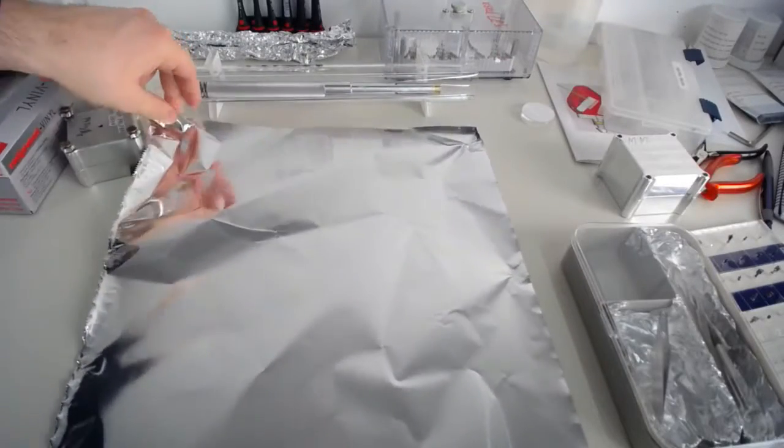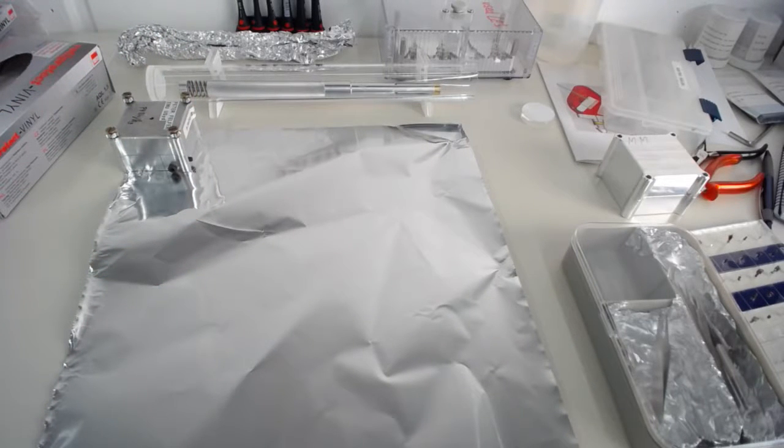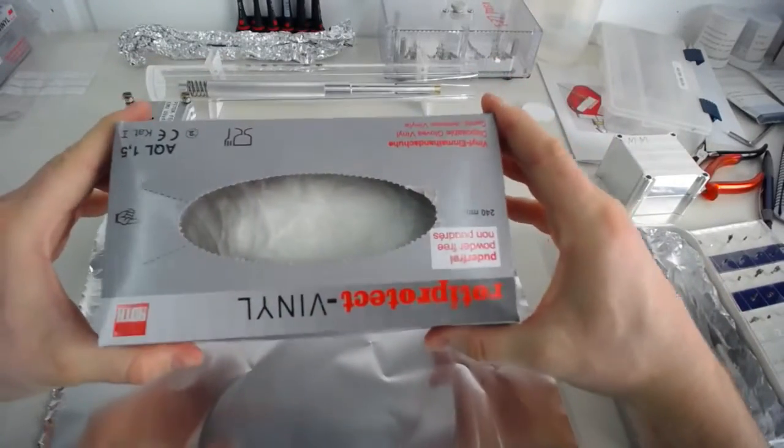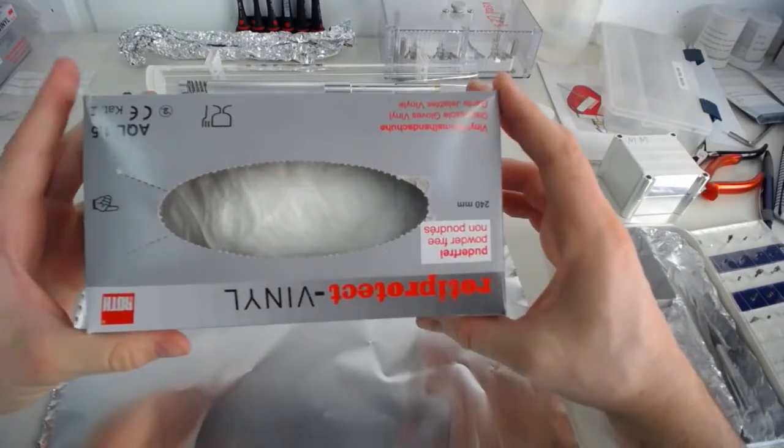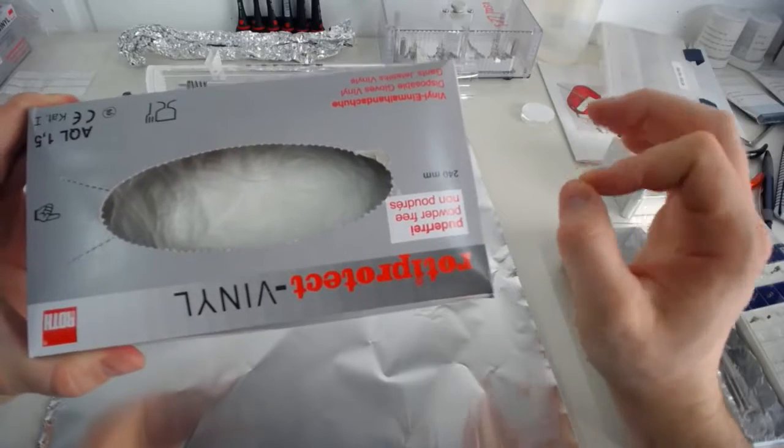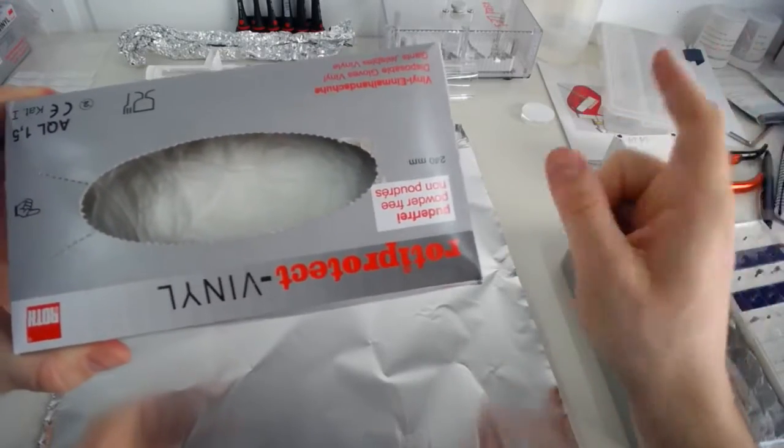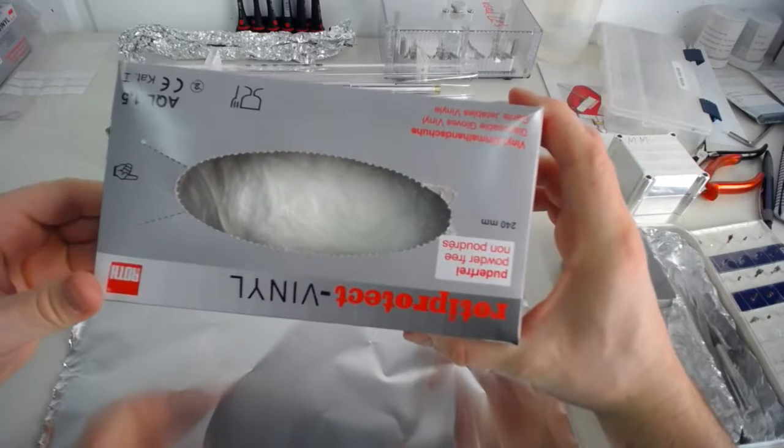We've had a leak like that before already and we could trace it back to the thin aluminum foil rubbing off flakes. So what is thick? Buy some laboratory aluminum foil. We use 30 micron. That's pretty much the thickest available and it does a really good job. Here we've got a piece of thick aluminum foil and on the side I've touched it, I can move stuff, but don't touch it in the middle. That's where our work area is going to be. The next thing we need is the specimen carousel and I'll get that out of the atom probe. For any work with any of the tools, we're going to wear gloves.